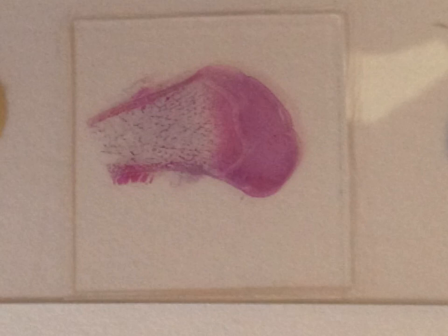This is another slide of characteristic shape, which is the growing bone. And as you see here, it is the shape of the bone. It may be transversely laid down or longitudinally laid down, so it may appear like this or like this.